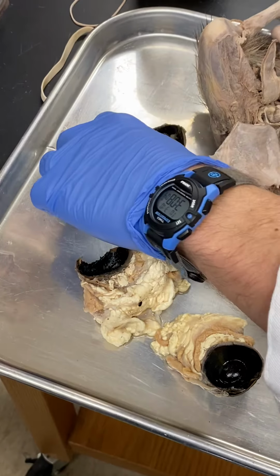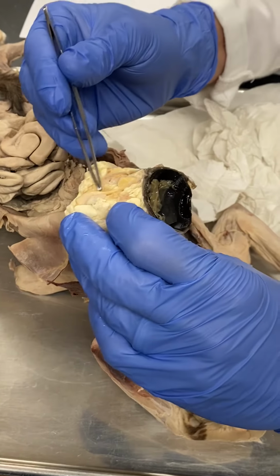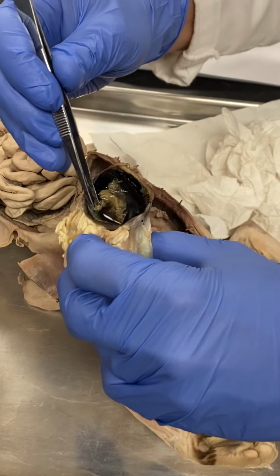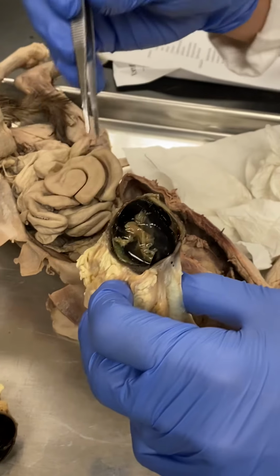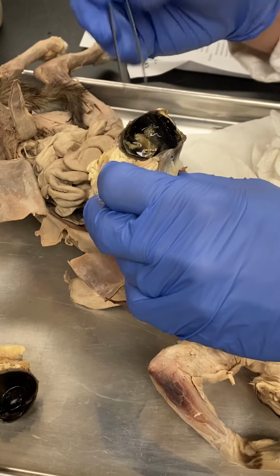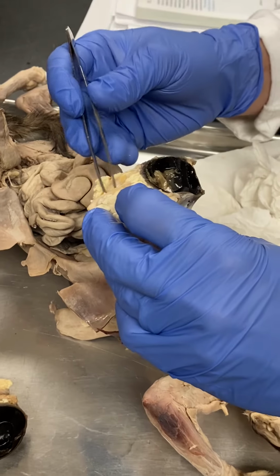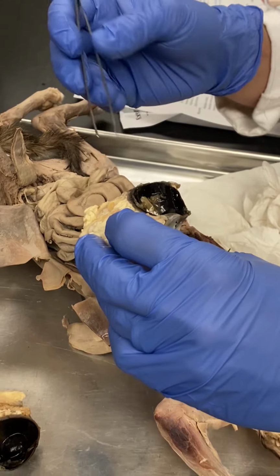You guys need to know, so here's the optic nerve, and it's been sliced here, but it continues right here. And here's where it inserts into the eyeball. That's known as the optic disc, okay? And the optic disc is also known as the blind spot. It's a blind spot because there are no photoreceptors there, because that's where the blood vessels and the nerve come into the eyeball, okay? And so there's that.